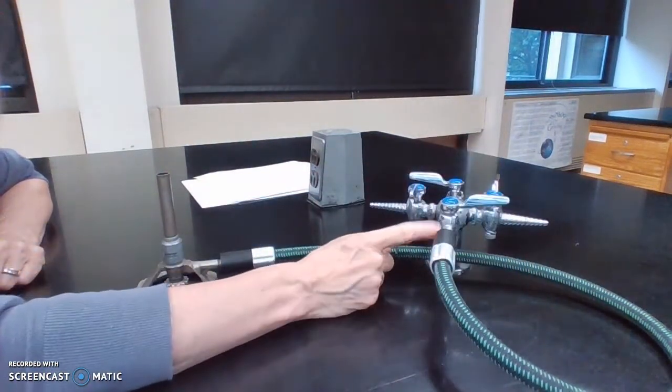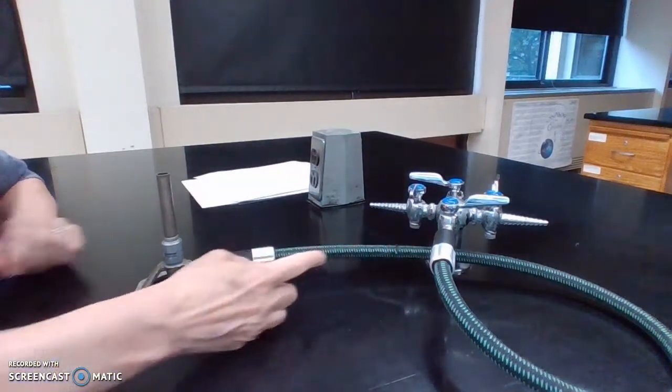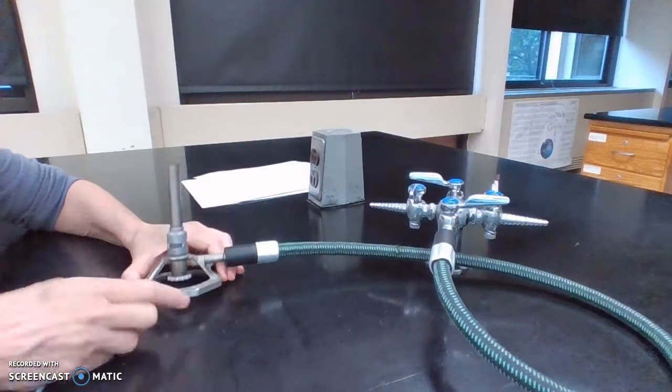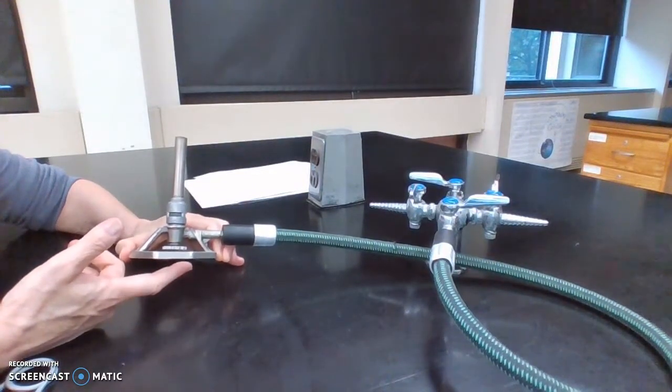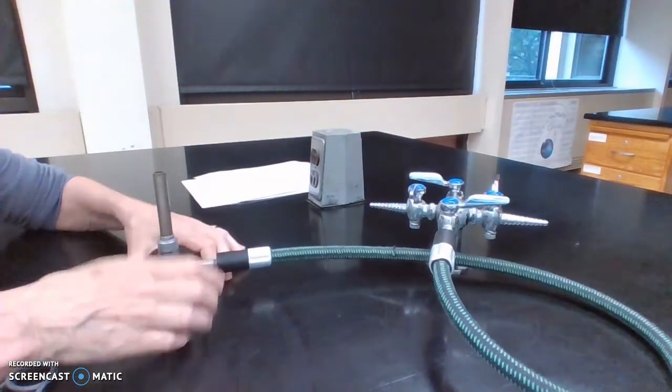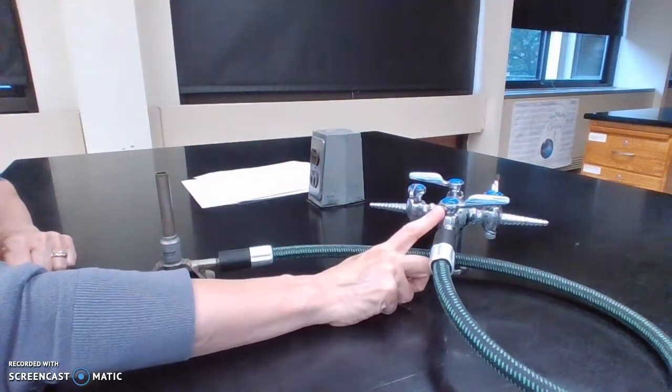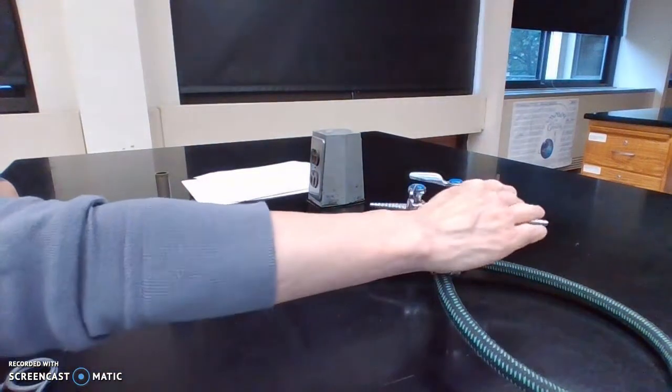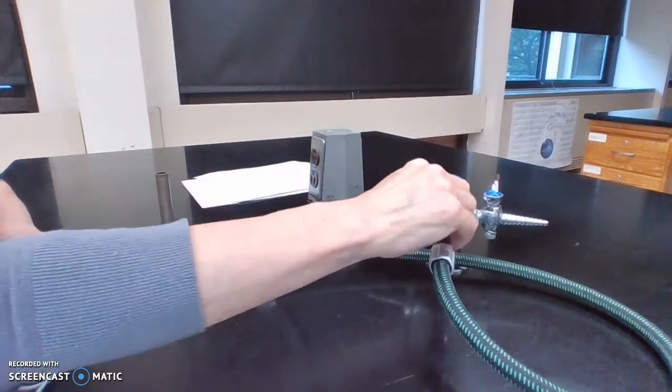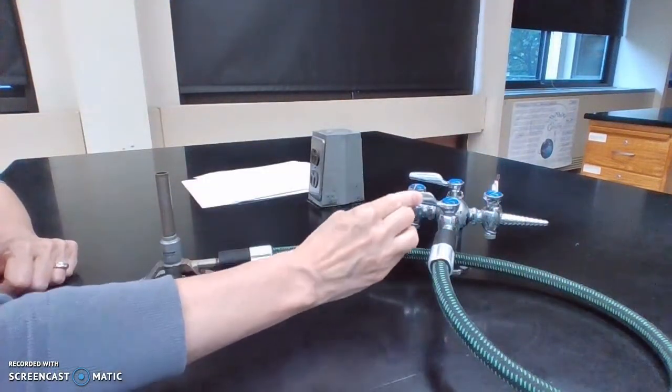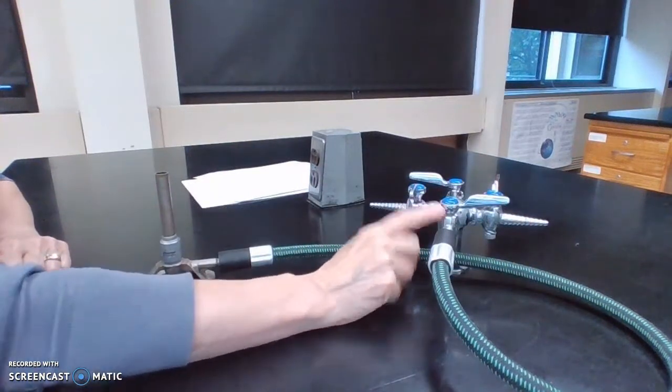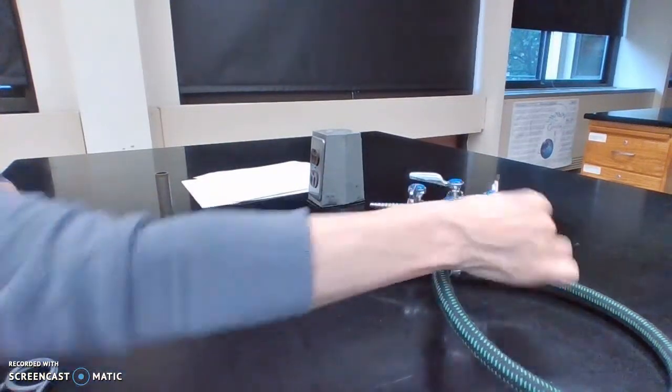You never need to put it in between perpendicular and parallel because that's going to give you a middle amount of gas, and you're actually going to use your needle valve on your Bunsen burner to regulate the height of the flame. So when I go to turn on my Bunsen burner, I'm going to turn this handle parallel to the spigot. You can turn it off perpendicular. On, you could turn it off the other way, although the one I'm using right here has one in the way. So on, off, that's it.